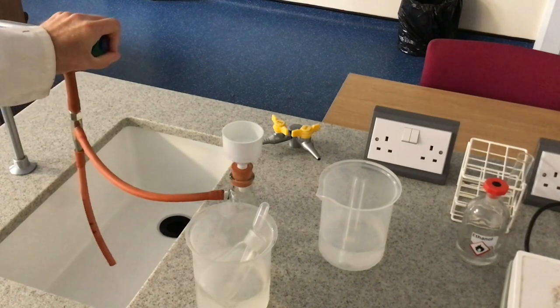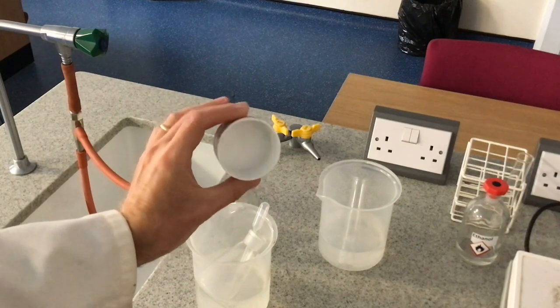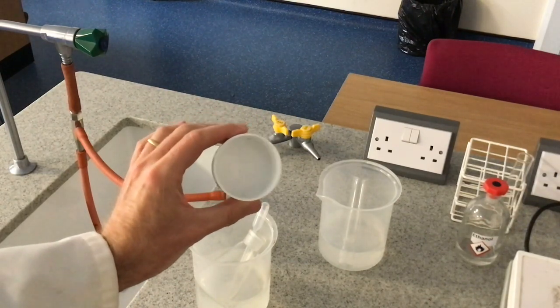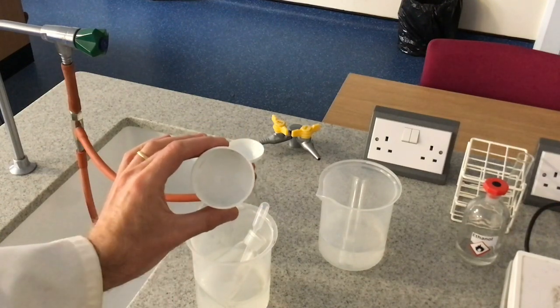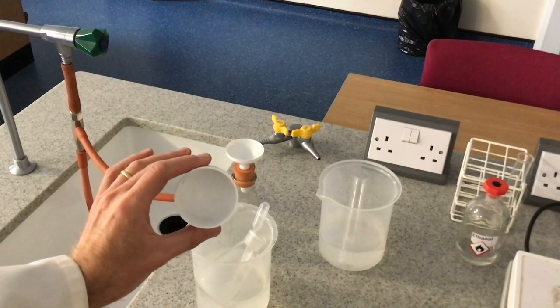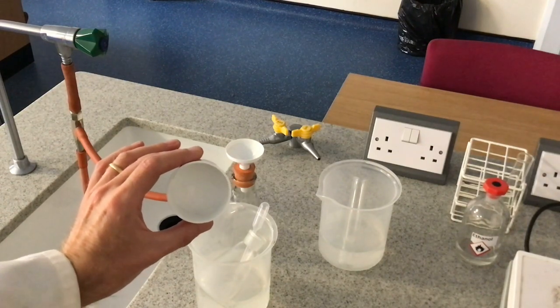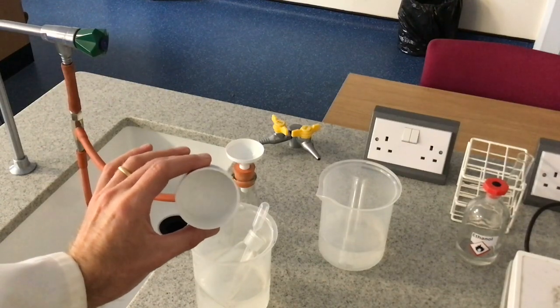I'll just turn the water off and show you what we've got inside the Buchner funnel — hopefully you can see we've got some nice shiny crystals of aspirin. The final thing we would do is transfer this onto a watch glass and let it dry overnight. Then the next day you would run some melting point tests and thin layer chromatography tests to check purity against the data values. Hopefully that was helpful and all those different stages make sense.